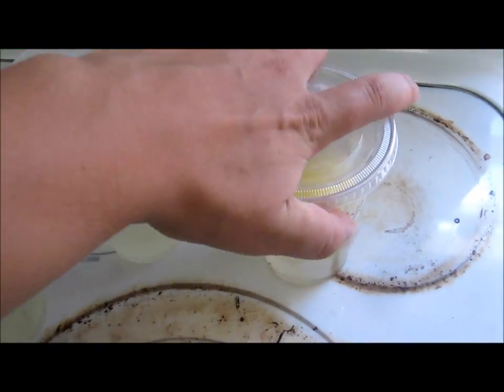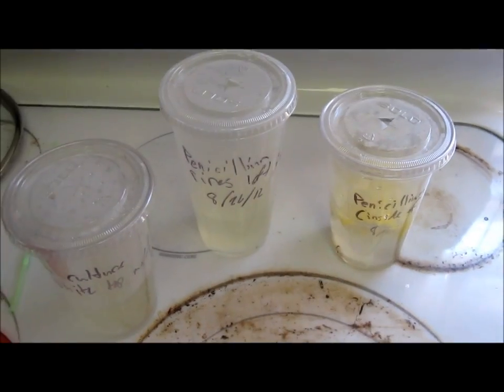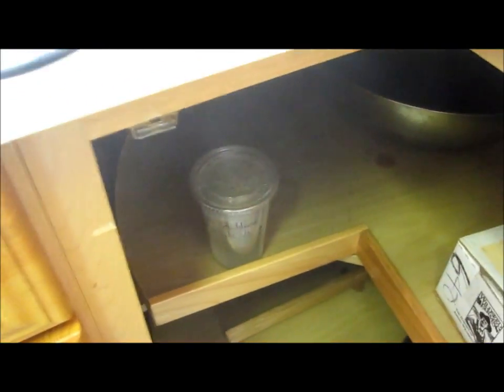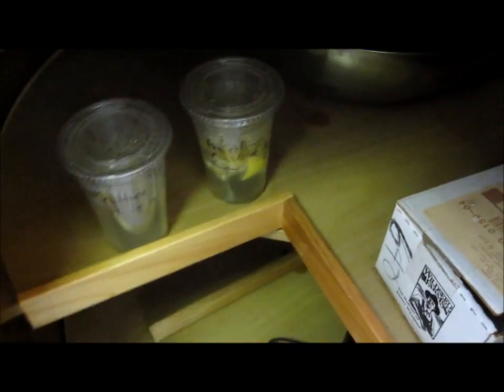And then the last one we'll just let grow. Alright, the last step is to switch the label and put them down here in the dark, and we'll come back to them in a couple days.